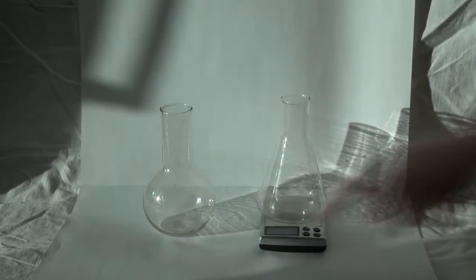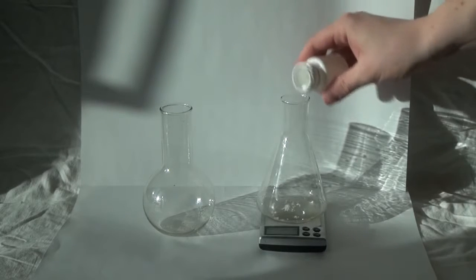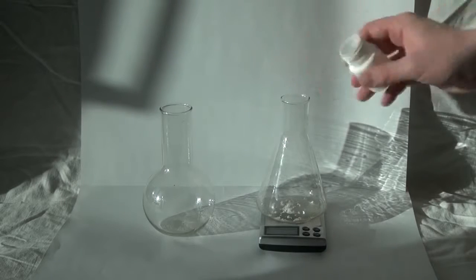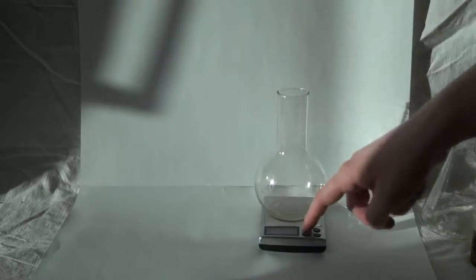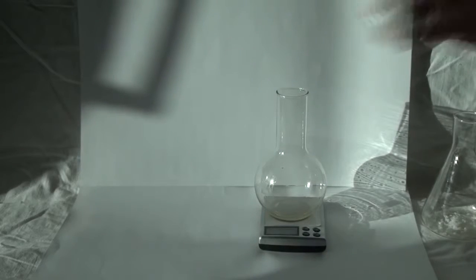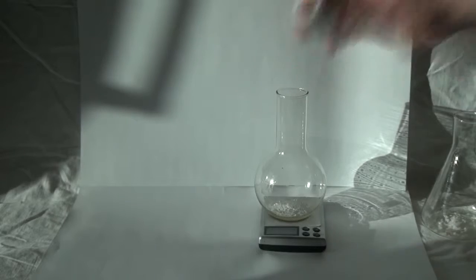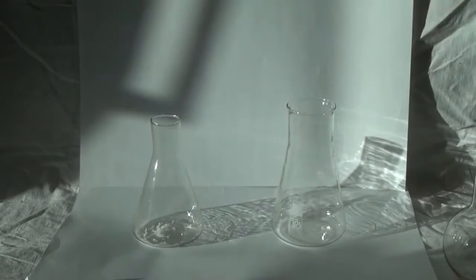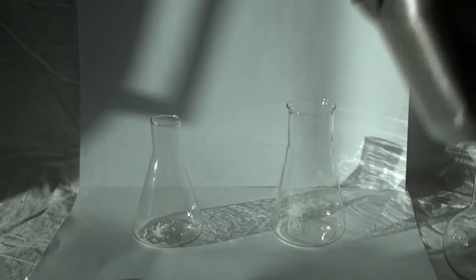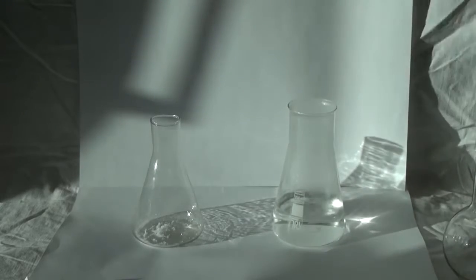To begin, let us take two flasks and pour into each of them one gram of substance. Also, be careful with lead salts, as they are quite toxic. Once we have poured the gram substances into the flasks, pour into each flask 175 milliliters of hot water.